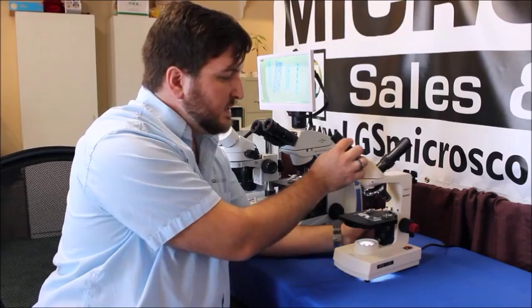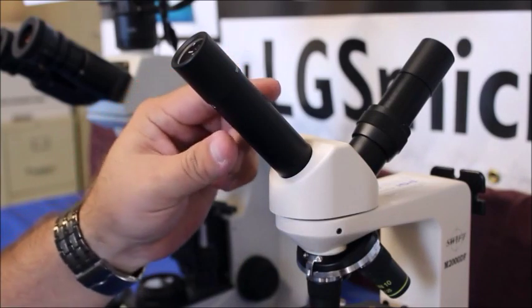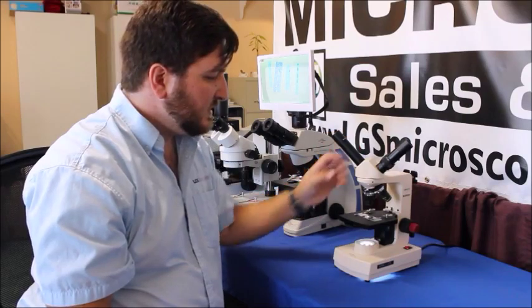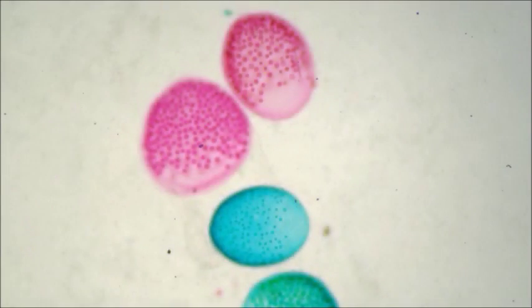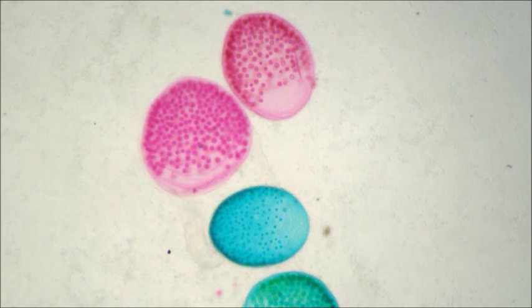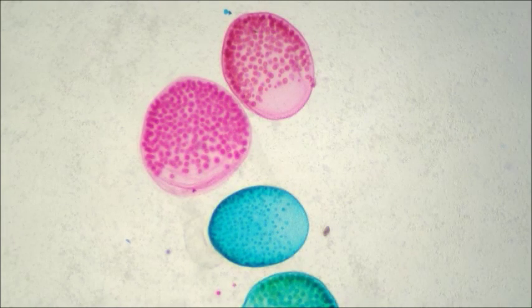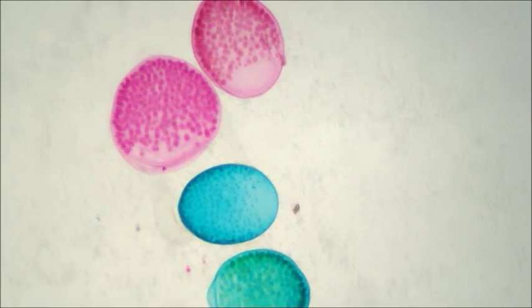So what we're going to do is we're going to use this eyepiece that does not have anything special on it. We're going to get our sample in focus there first. Now I'm going to use the same sample as the last video just so it all looks the same and familiar, using the coarse and fine focus to get a good image.